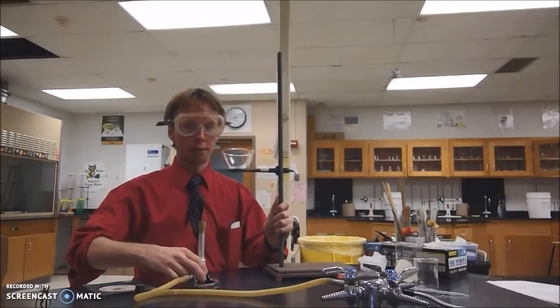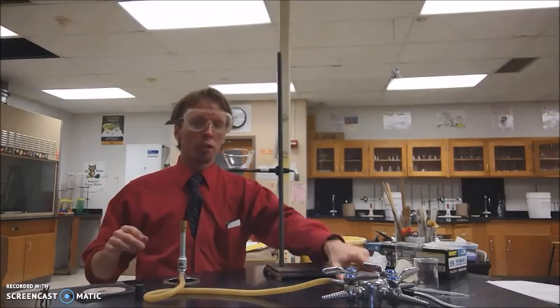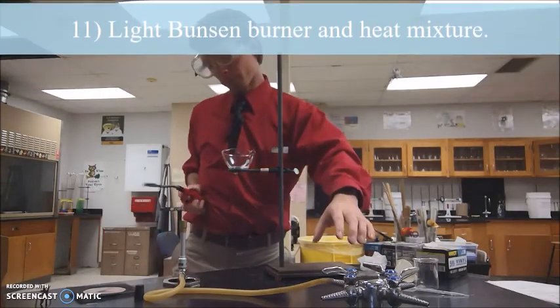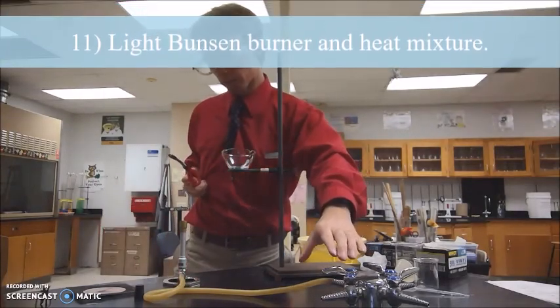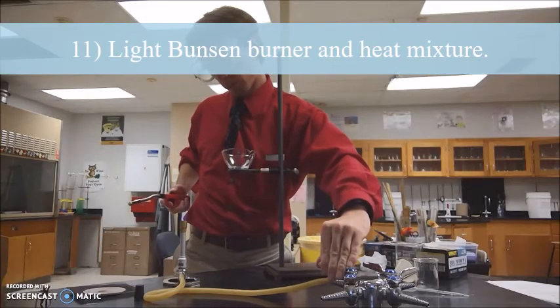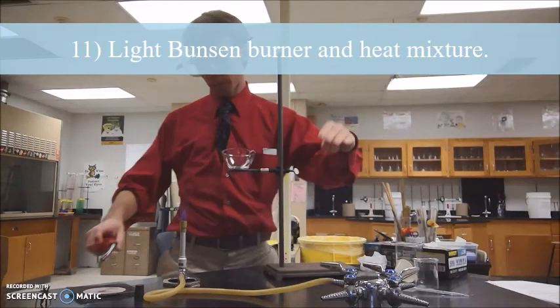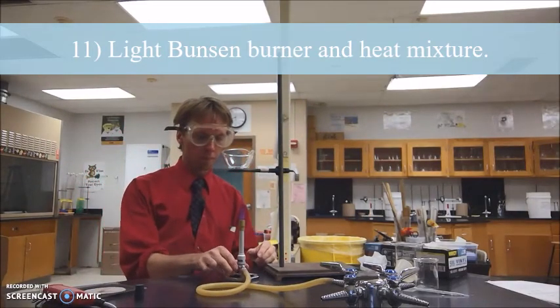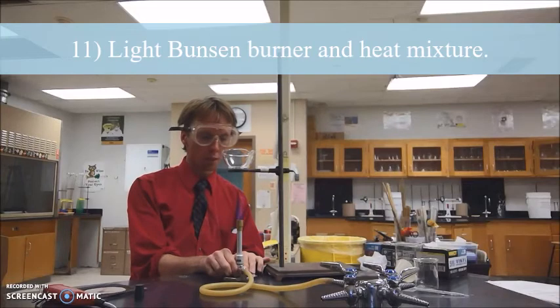I'm going to set this aside for a moment here. You'll go ahead and go back to lighting your Bunsen burner. Remember, always fire first. And then, if you need to, you can raise up your flame height.